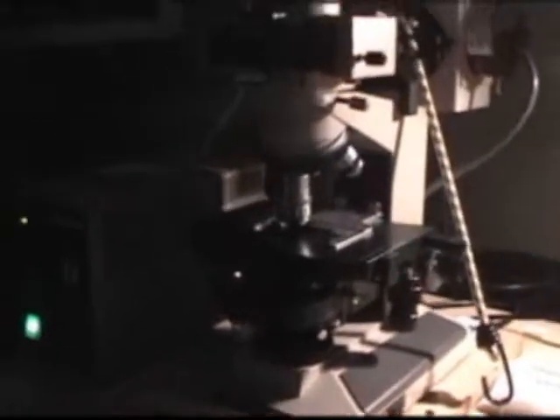Of course, standard equipment that we take on board a research vessel is a microscope, so we can see what kind of microorganisms are present when we're at sea. We've just taken a small piece of one of the labs here on board the Seward Johnson, and sealed it off with black plastic to make this little dark room so that we're able to see by epifluorescence down the scope.